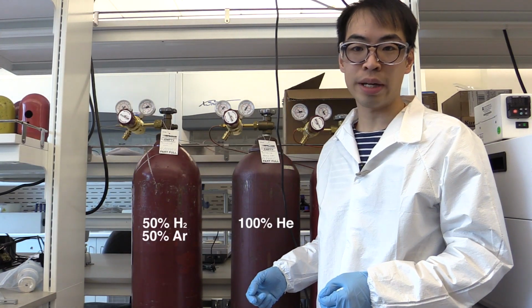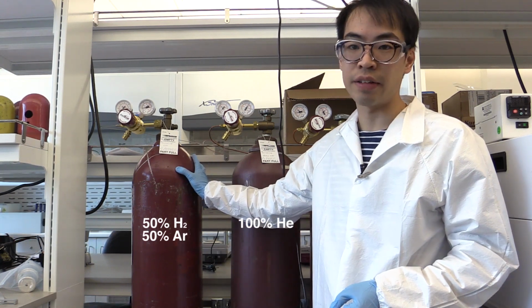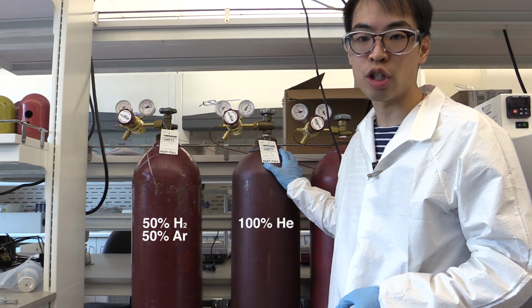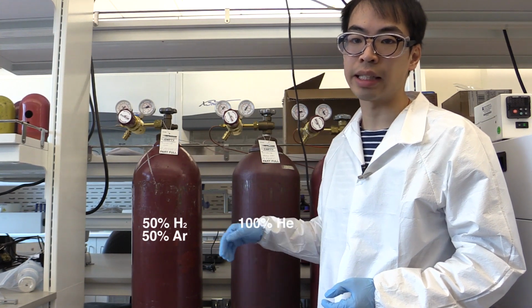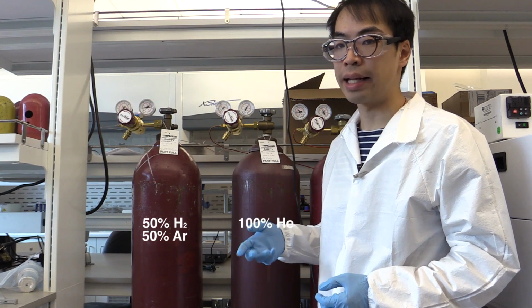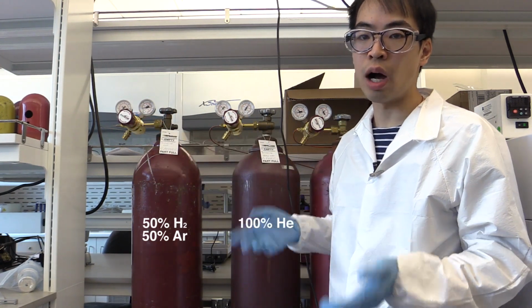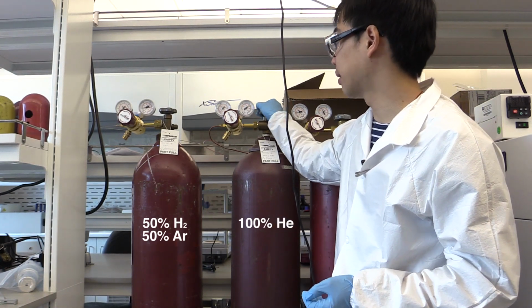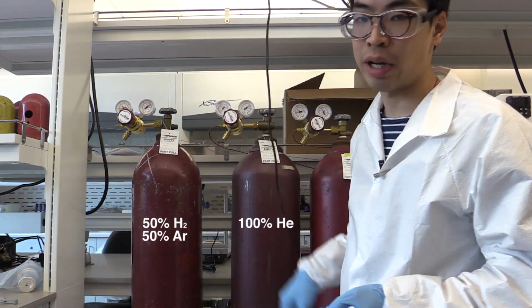The two gases we have hooked up to the RTGA are right here. The far left is a 50-50 mixture of hydrogen and argon, and in the middle we have a 100% helium tank. We'll use the two gas tanks to calibrate the RTGA and the mass spec for our samples. The regulators should be set at the appropriate pressure, so when you turn them on, all you should need to do is open these main gas supply valves for the cylinder, and you shouldn't have to adjust the regulators at all.